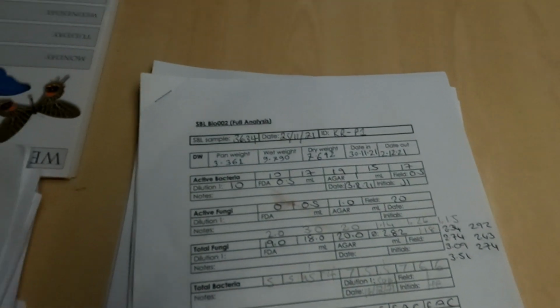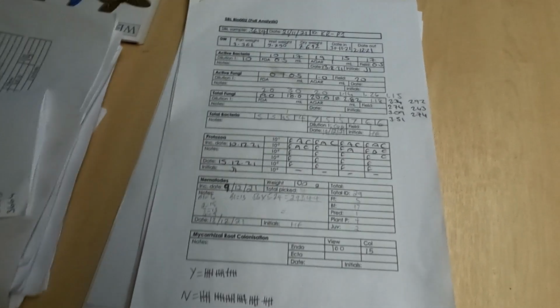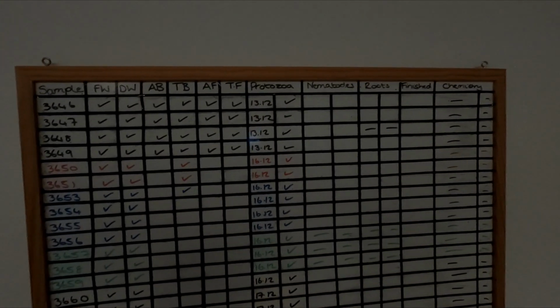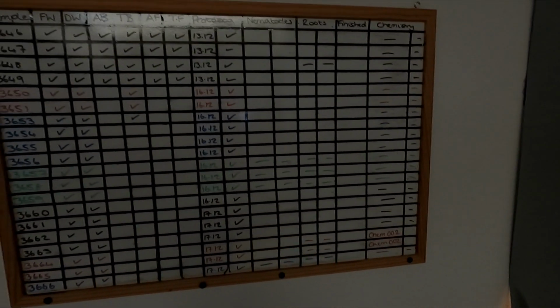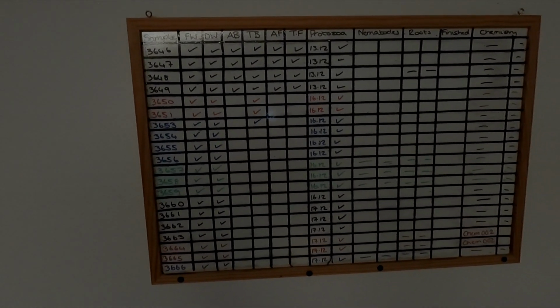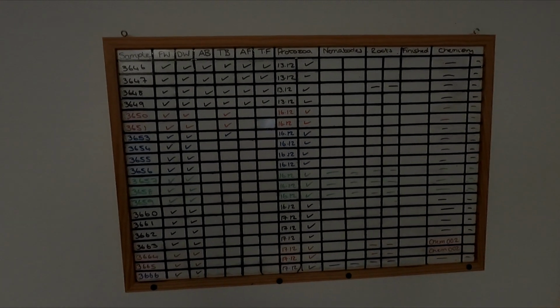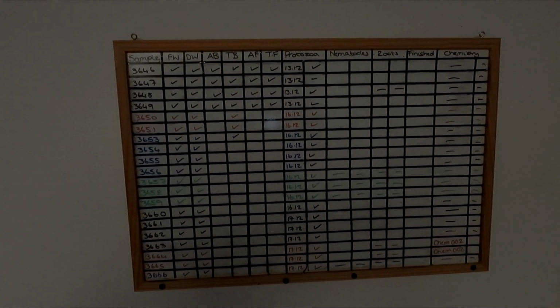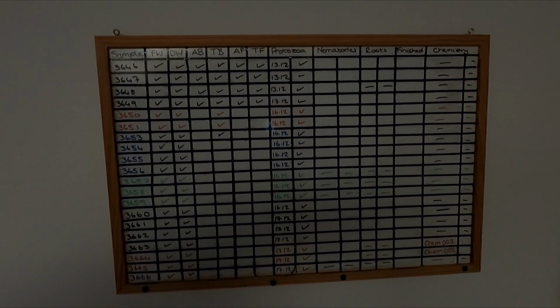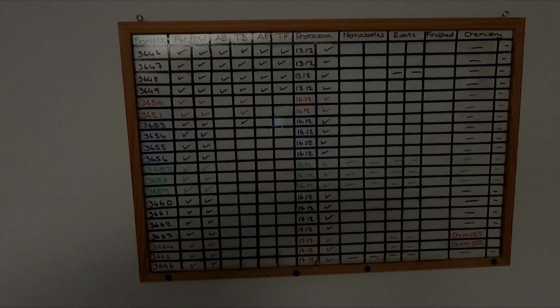Once it's logged, there's usually some kind of data record that is taken, and you can see all these sheets that we have for the various samples. That extends to our board of fame, where we put all of the active samples that we have working on in the laboratory at any one time. Actually, this board should really be about 10 times this size because we've had a really busy period of late. Probably the most samples we've ever received in a winter period, and super busy. So yeah, this board doesn't really reflect what we have going on.